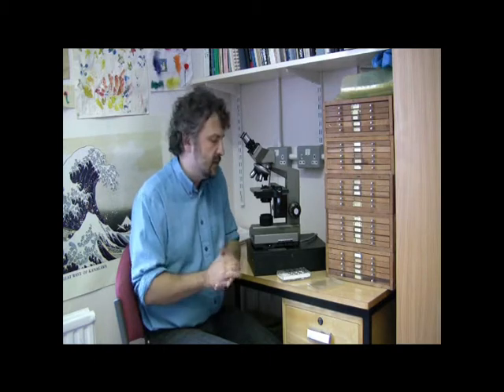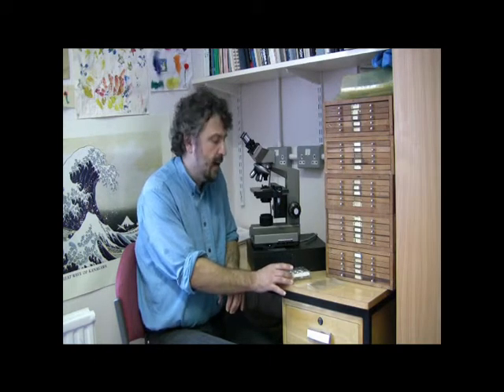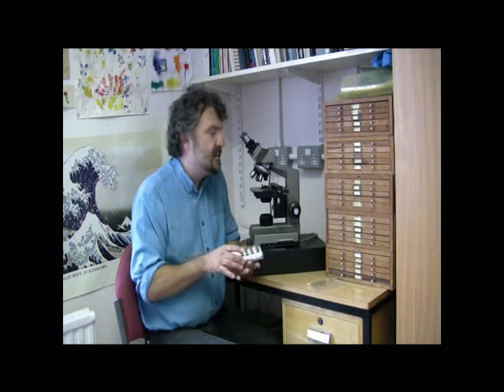But for more taxonomic work, looking at the fine detail of their skeletons and so on, we often use scanning electron microscopy.